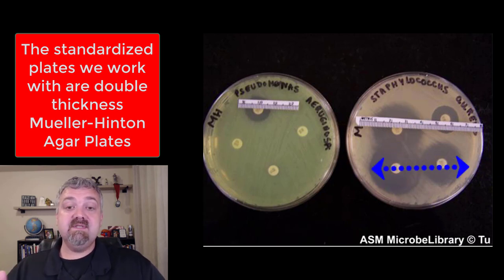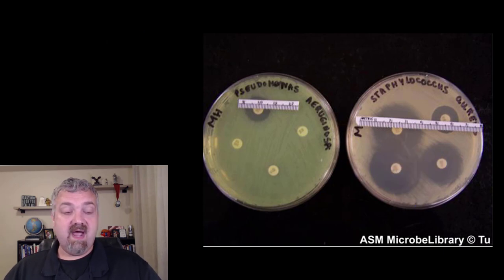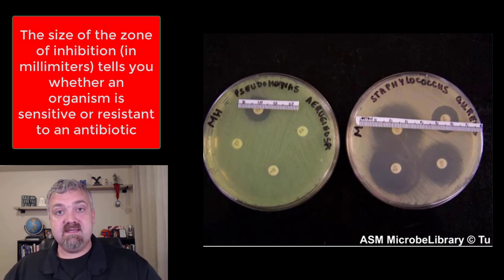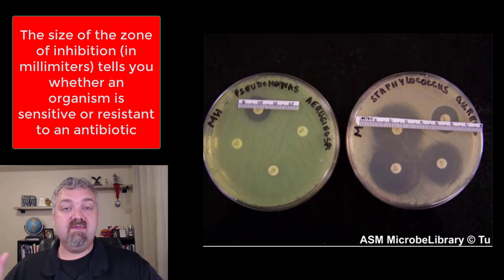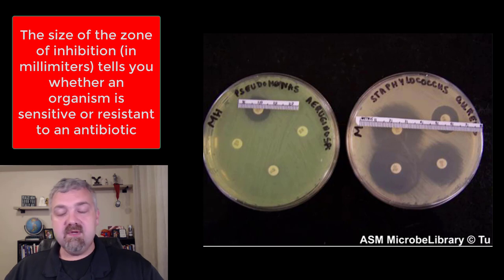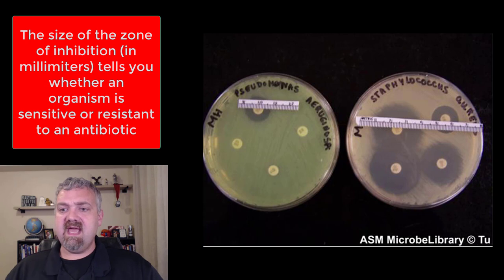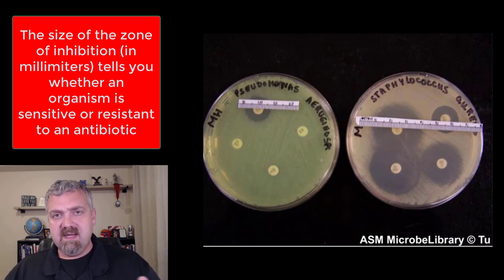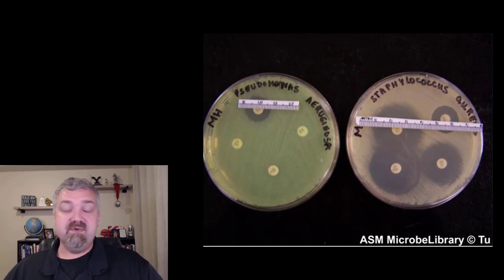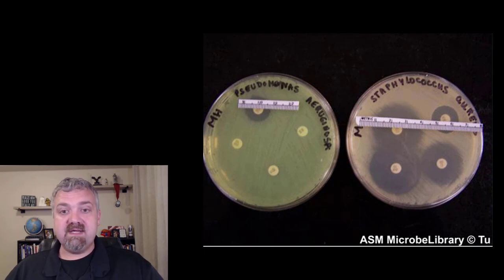These zones of inhibition, once you actually measure them, we have to compare them to data tables. We have data tables that say for this antibiotic and this organism, this size of zone of inhibition means that it's sensitive and it works. If it's smaller than that, it might be intermediate, which means it sort of works, or it might be resistant. So just looking at a plate and saying this zone of inhibition is the biggest so it works the best is not actually true. It also won't tell you if it kills the microbes — if it's bactericidal or just inhibits their growth, bacteriostatic.